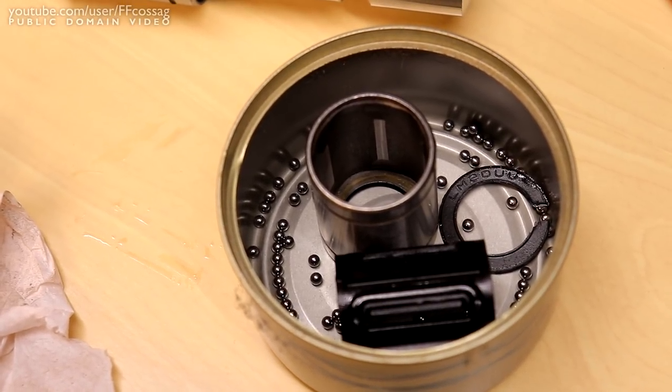Okay, so after shooting that segment I took one of these bearings apart to ironically have a look at them under the microscope. Upon doing that it becomes quite obvious what the issue is, and that's the bearing race. The shiny part there is very coarsely machined in these, so the balls have a lot of terrain to ride over.